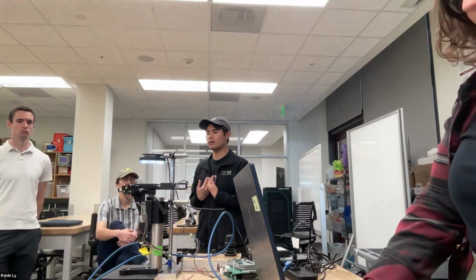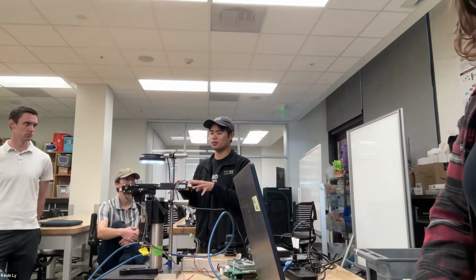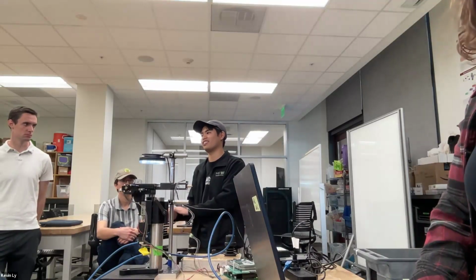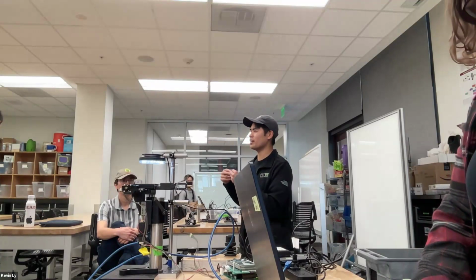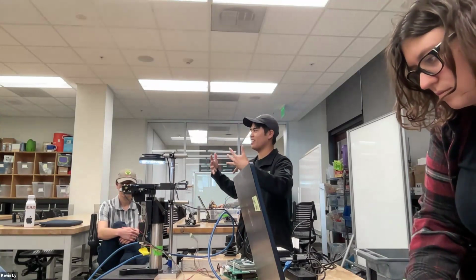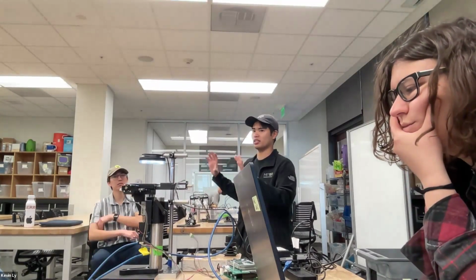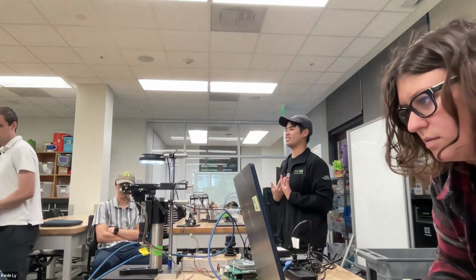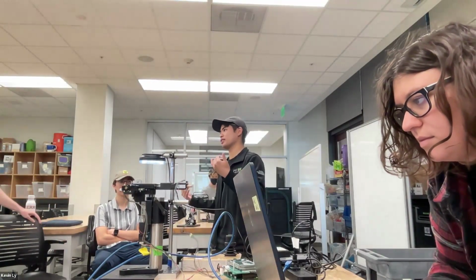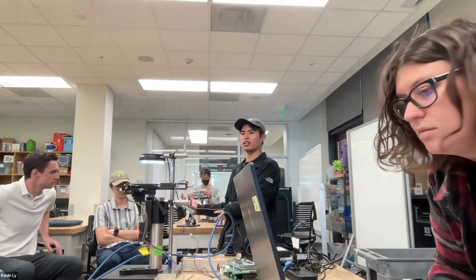So I like to think about the driver as the knowledgeable piece of code that sits between the high level software and the low level hardware. Another example is a camera driver. A camera is a whole sensor array, and you need a lot of hardware knowledge to control this array. But the programmer is just going to say, take picture, a very crude instruction, and the driver will be like, oh, I know what that means. It means they want to do these things to this array and all these hardware level things.